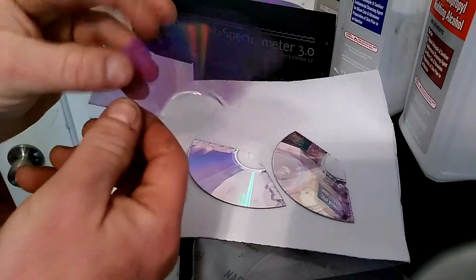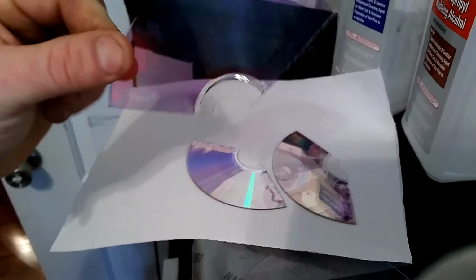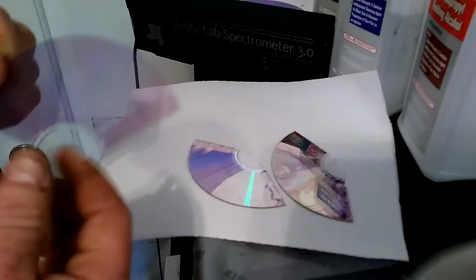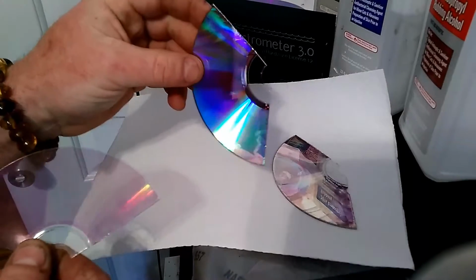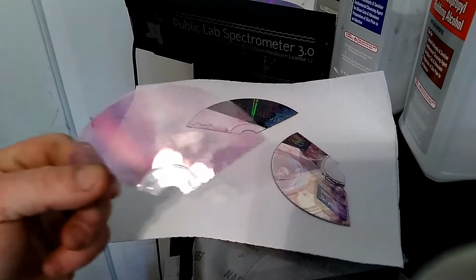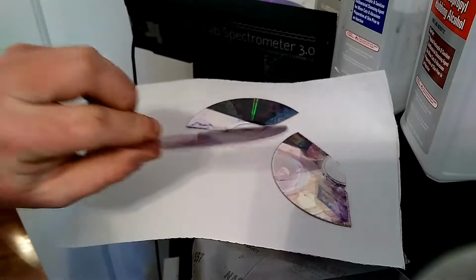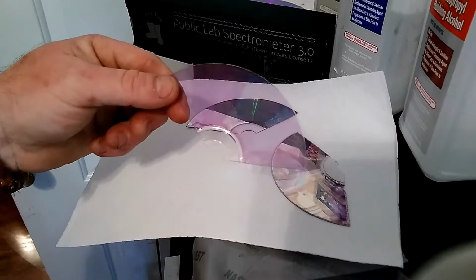I don't know if you can see it, but there's a purple dye haze on it, and I was having the hardest time getting it off evenly and completely. Some of the instructions said you can leave the purple haze on, it's not going to do anything, but with my basic science I'm thinking there's got to be some interference with the green light, which of course is one that we need. I read that a bunch of people were having the same issues. So I tried a bunch of different stuff, soap and water, all that, and I couldn't get it to come off.